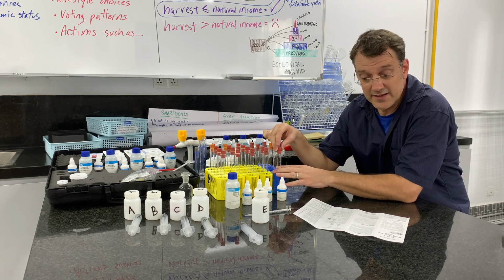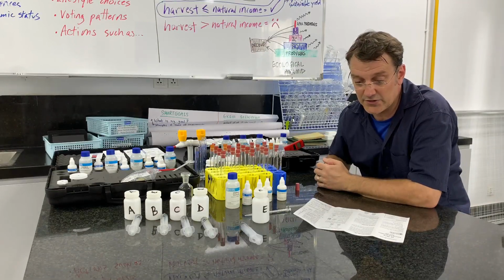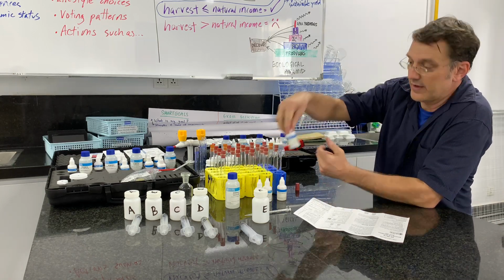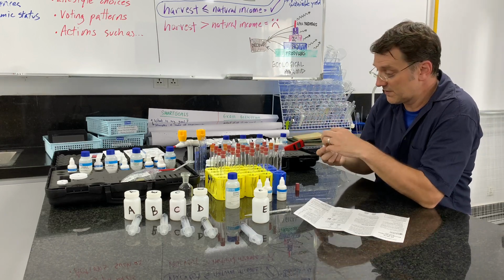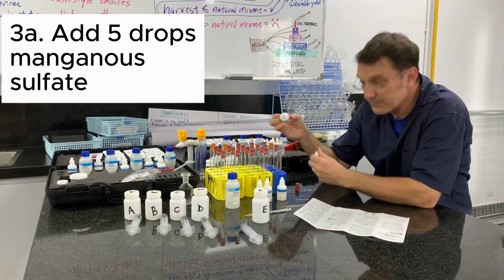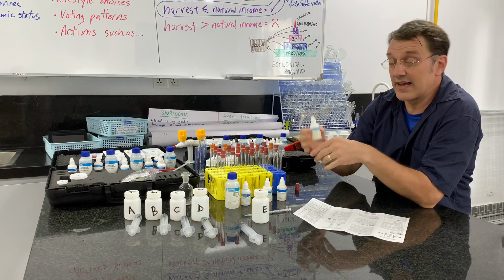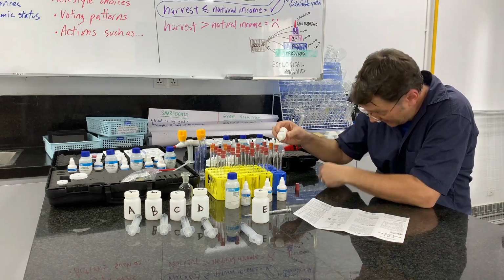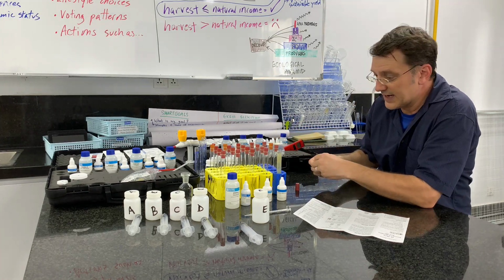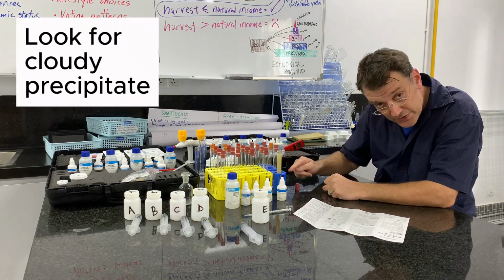Right? Then, step 3, remove the stopper and add 5 drops of manganese sulfate solution and 5 drops of alkali azide reagent. Here's my manganese sulfate solution. I'm going to add 1, 2, 3, 4, 5. Very straightforward. Here's my alkali azide reagent. Again, 1, 2, 3, 4, 5.